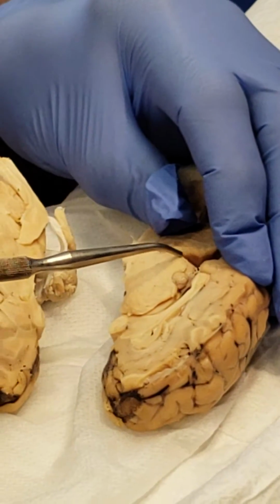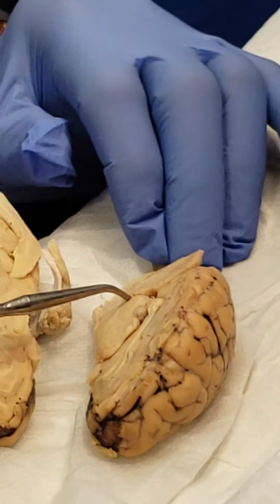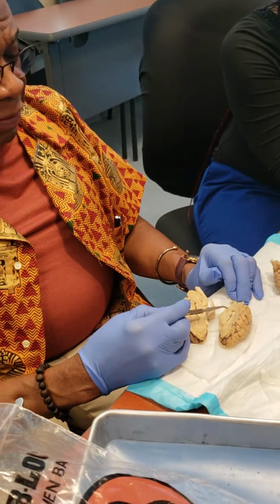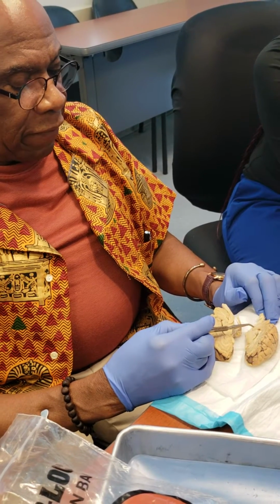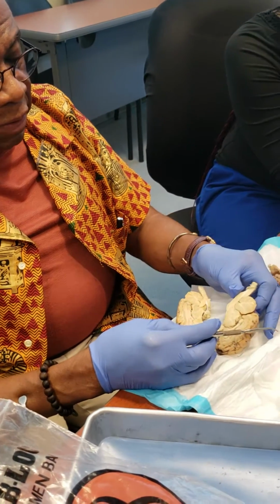You all right today? You sure? Yeah. All right. This is the canal, the cerebral aqueduct. Now, if I tell you, okay, I'm going to give you a lab exam. What is this area that's anterior to the cerebellum and posterior to the pons? And you're going to tell me, oh yeah, that's the 4th ventricle. From the 4th ventricle, it enters into the spinal canal. Now this area, this is the cerebellum, of course.